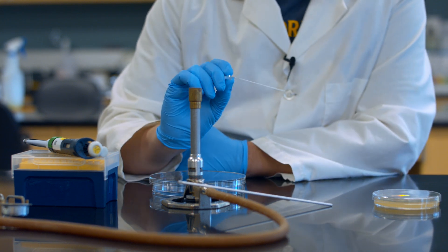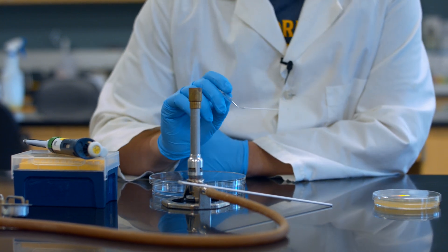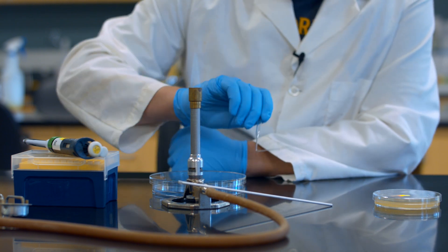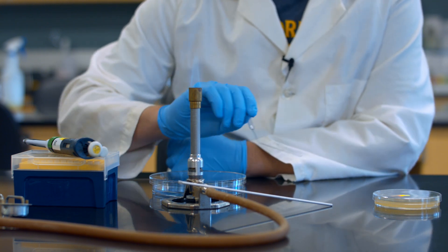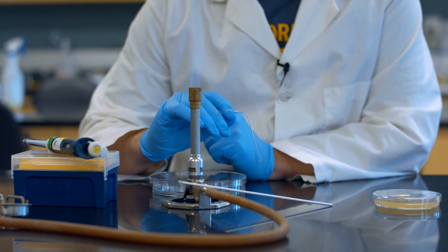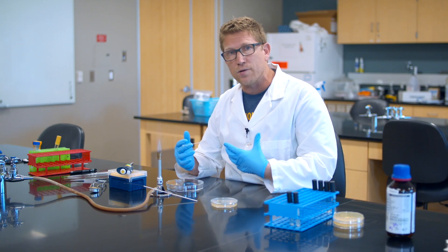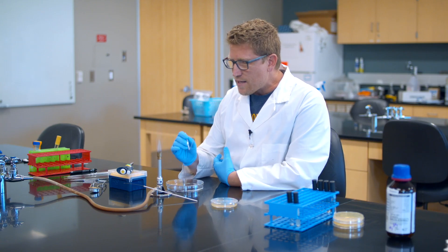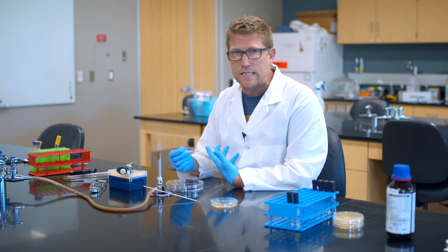So now what I have is a tool that we affectionately call a hockey stick, it's really just a glass spreader, that I can rub a liquid culture of bacteria across the surface and get them to spread really evenly without shredding them or injuring them in any way. Now this glass pipette just came out of a box, it's not sterile.